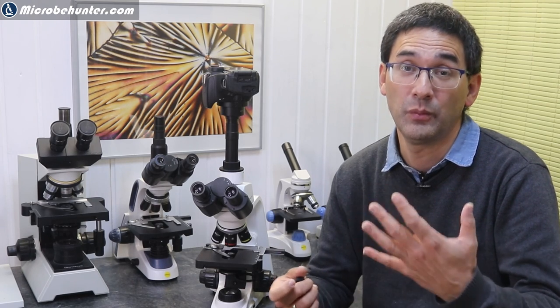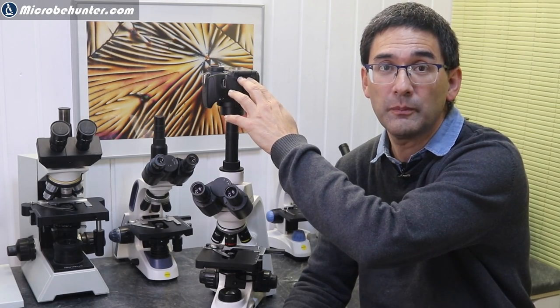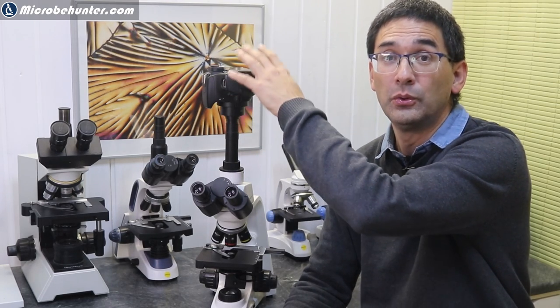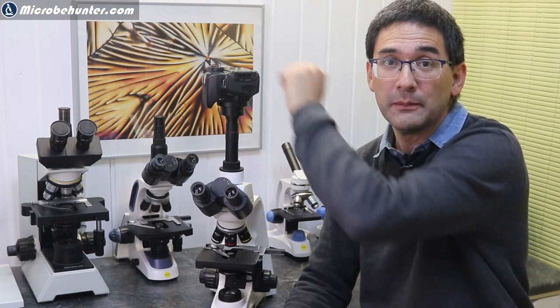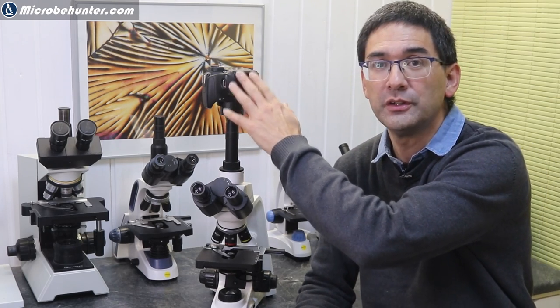Now there are a few disadvantages concerning the live view. One of the disadvantages is that depending on the camera, the resolution might not be quite as high. Some cameras do not feed out a full resolution HDMI signal — especially older camera models will only show what you'd see on the camera screen. More modern camera models will actually output a higher resolution than what you're able to see on the screen, which is an advantage.